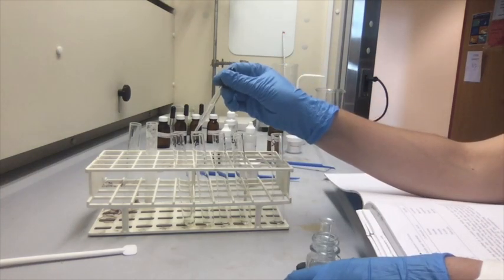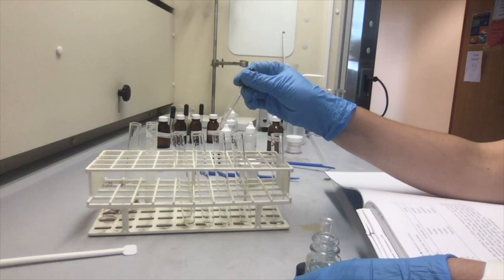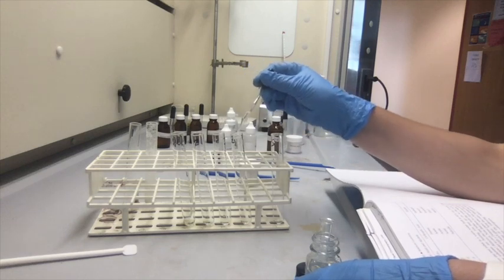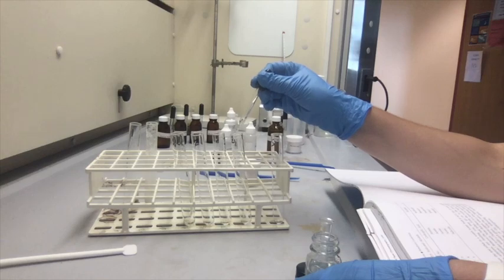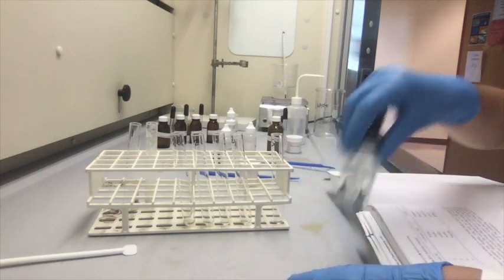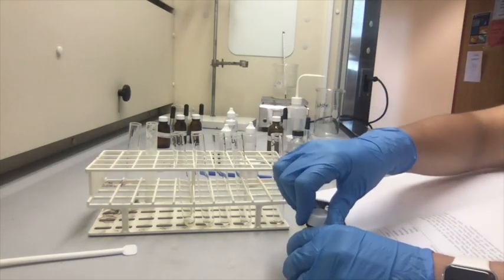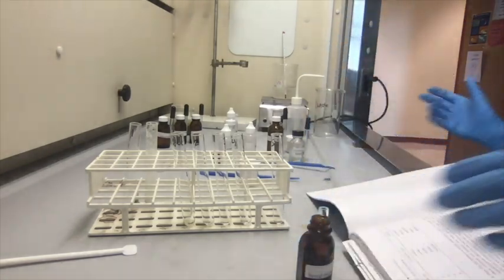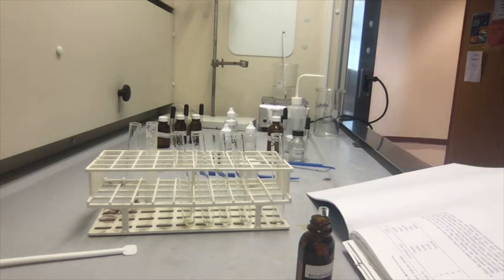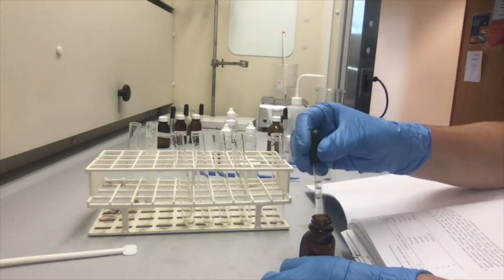Just like that. And then we're going to add benzyl alcohol to test tube number 2. And this is going to be 10 drops.